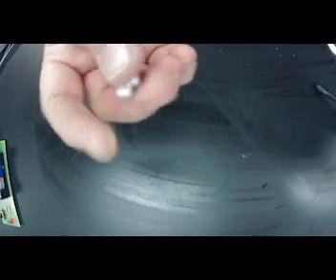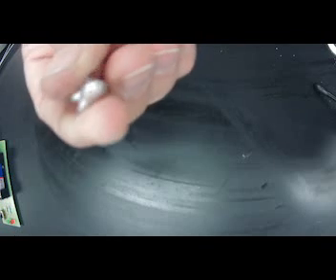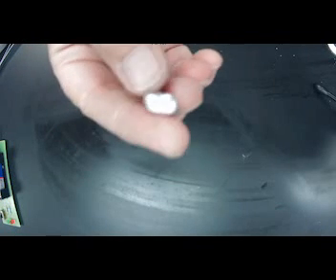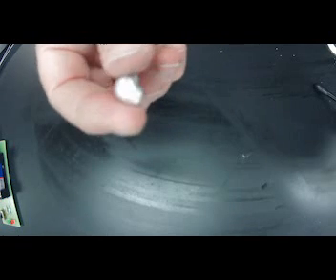It's kind of a silverish color. As far as luster, it's kind of shiny. It's a little bit dull. And some other properties. Well, it's hard, okay? And it's silver. It's stuck to itself. Its shape is kind of odd shaped, right? And then we're going to take a look at a couple of things.